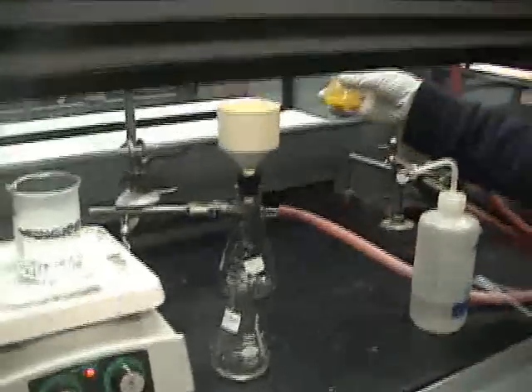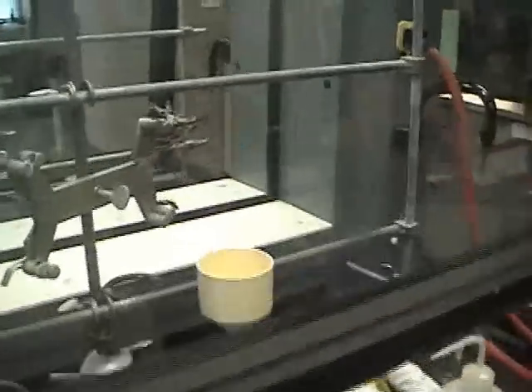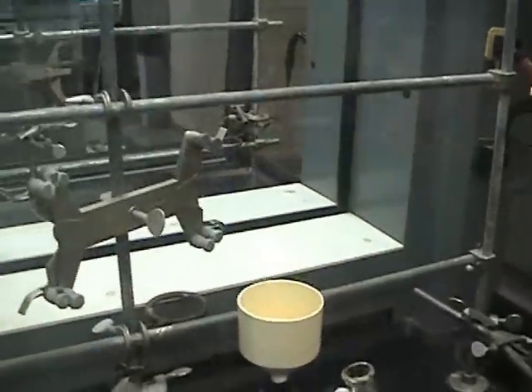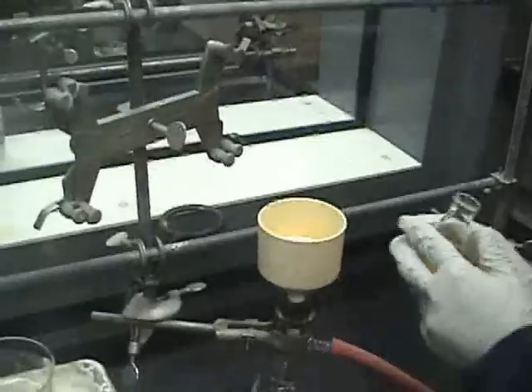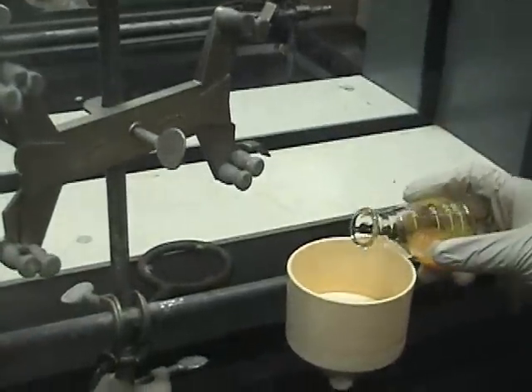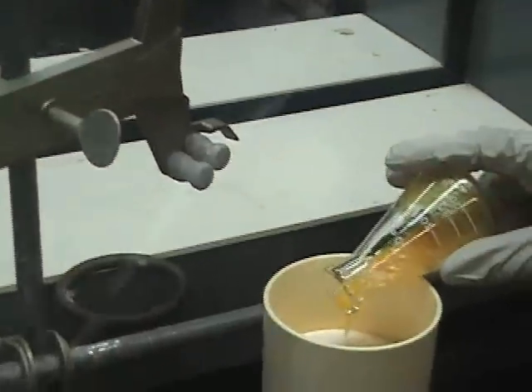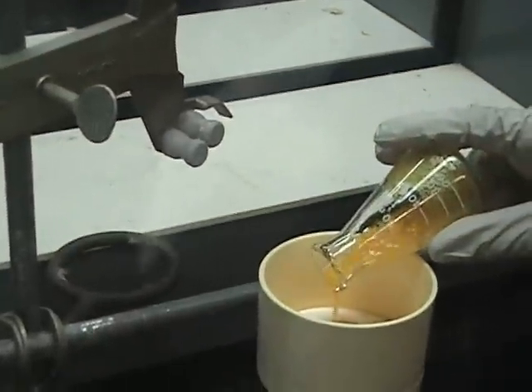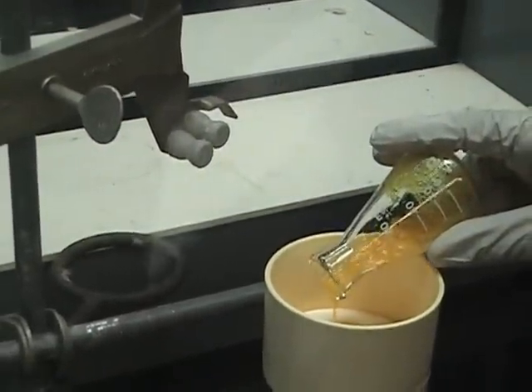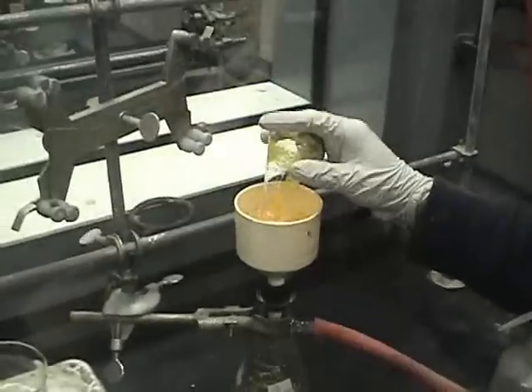Then you let it stand for about 5 minutes for crystals to form. After 2–5 minutes, if your crystals have not formed, you can heat them in a hot water bath for about 2 minutes. Then let it cool to room temperature to get your crystals. Once you get your crystals, you are going to collect them by vacuum filtration and use cold water to rinse your crystals.